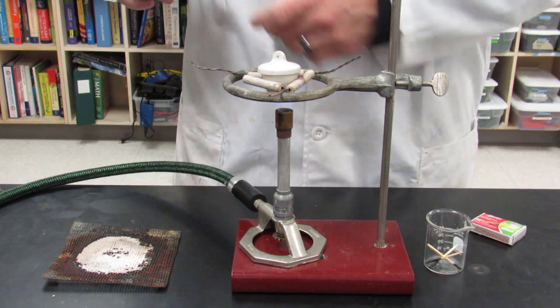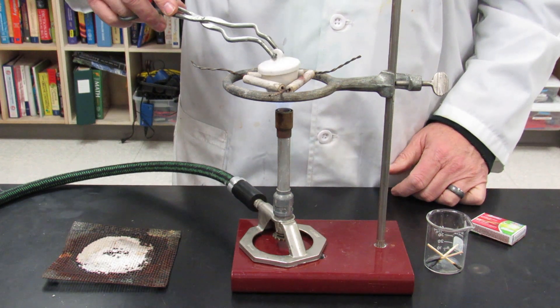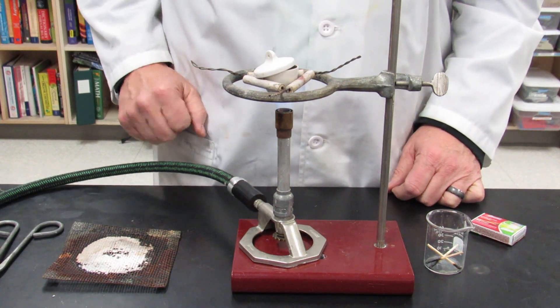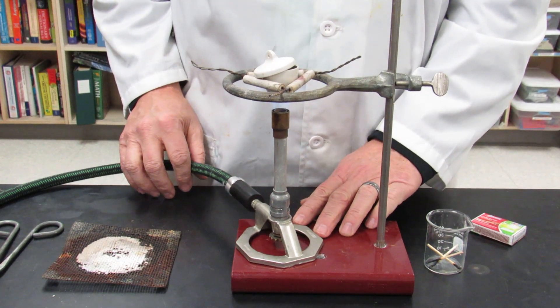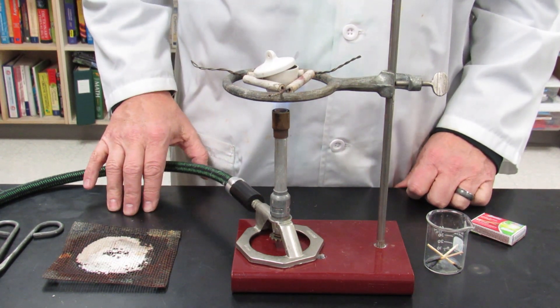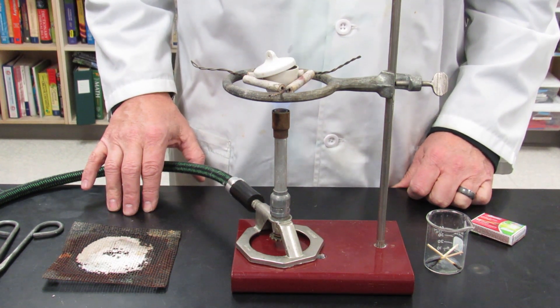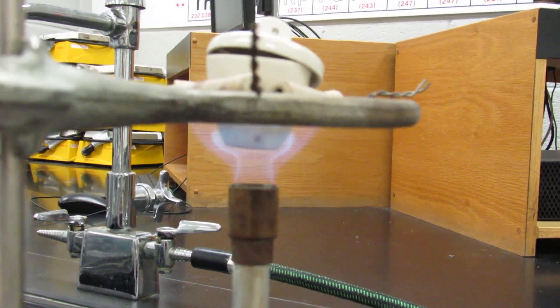And then put it in the hottest part of the flame for a solid 15 minutes with the lid slightly ajar. You want to have a very hot flame. It should look like this. Intense. Up against the bottom.